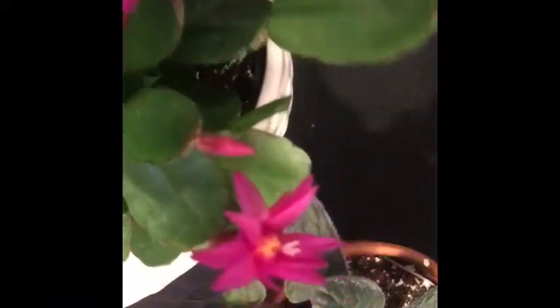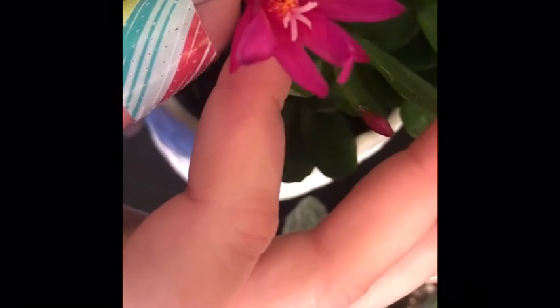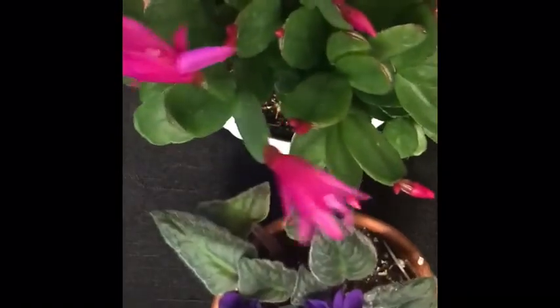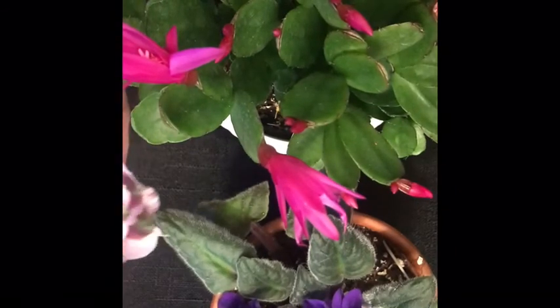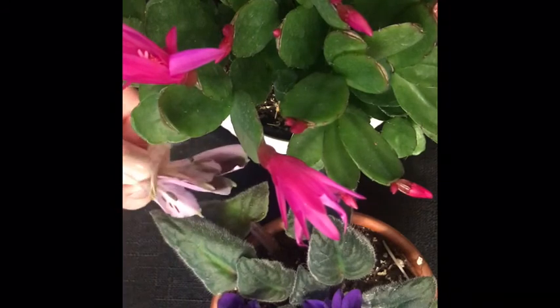And then this is a cactus that I can't remember the name of. Miss Marina just got it also at Trader Joe's. But hopefully, there we go. So if you can see also the yellow is where that pollen is, and those four kind of octopus arm looking things in the middle, that's that pistil. So that's where all the female parts are. So you can kind of see all flowers have different structures. They all are composed of the same parts, but they just present themselves differently.